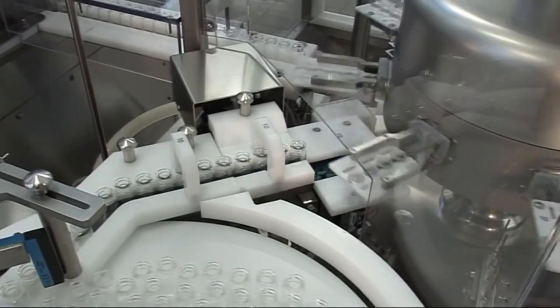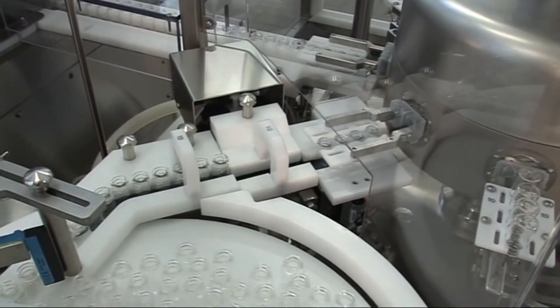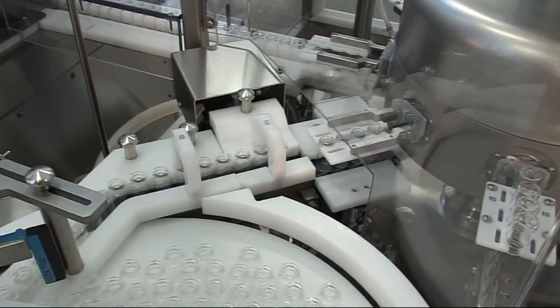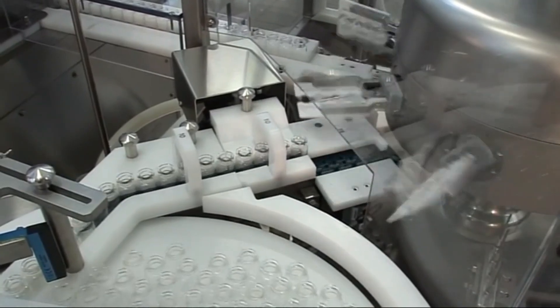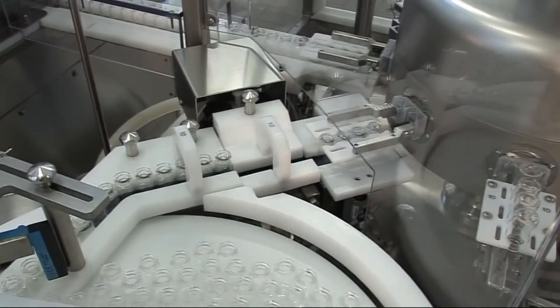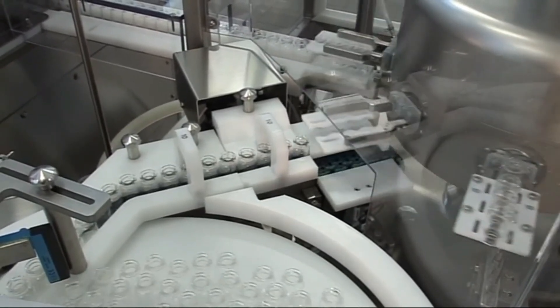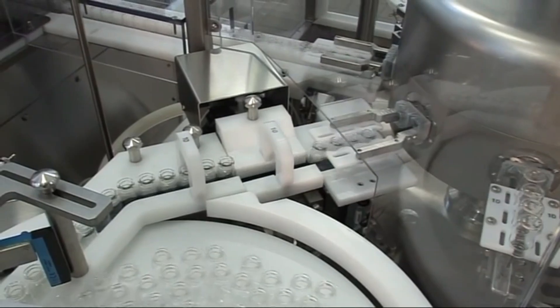RABS is common in filling lines for sterile products. Cost: Generally, RABS is less expensive to install and maintain compared to isolators, due to simpler designs and less rigorous environmental control.